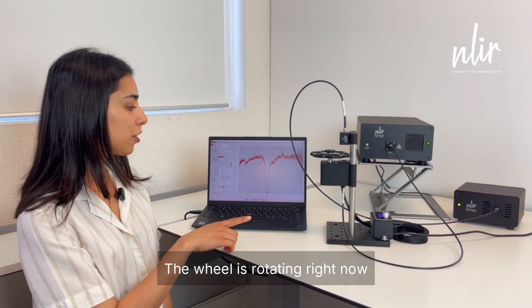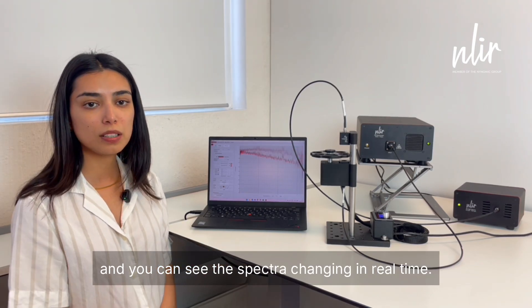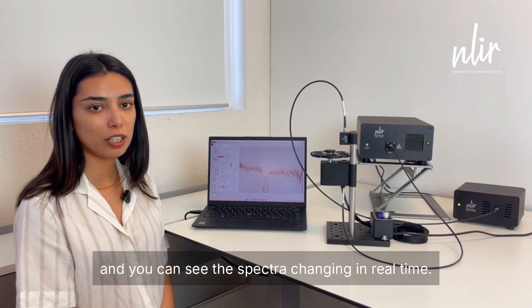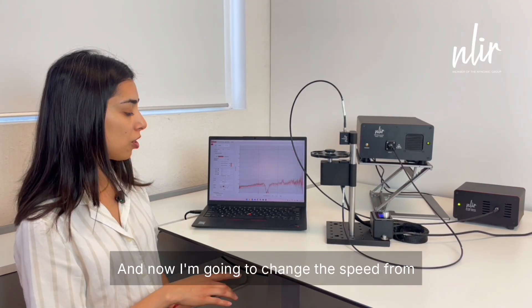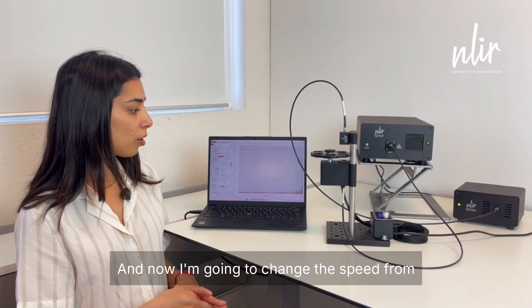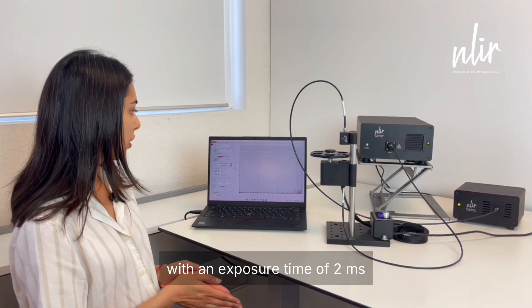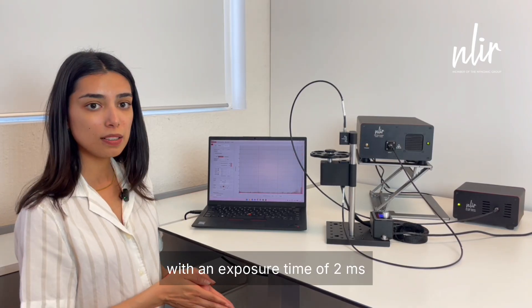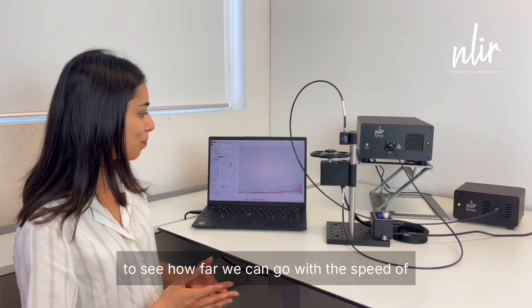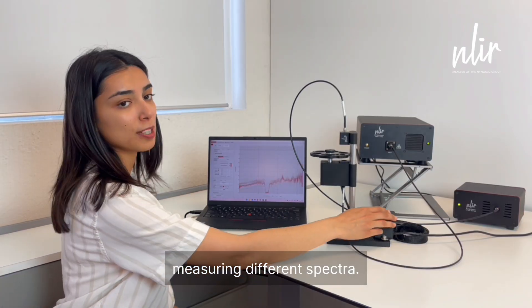The wheel is rotating right now at 10 rounds per minute and you can see the spectra changing in real time. Now I'm going to change the speed from 10 rounds per minute to 300 rounds per minute with an exposure time of 2 milliseconds to see how far we can go with the speed of measuring different spectra.